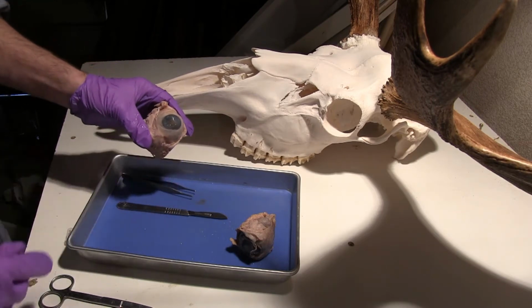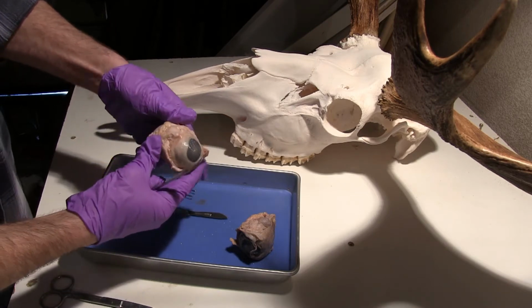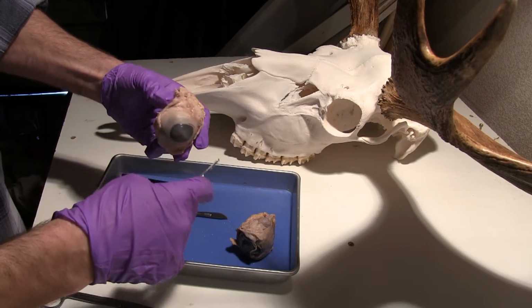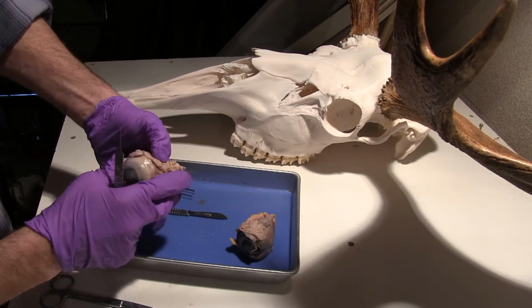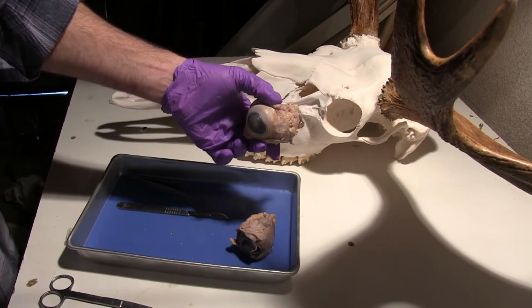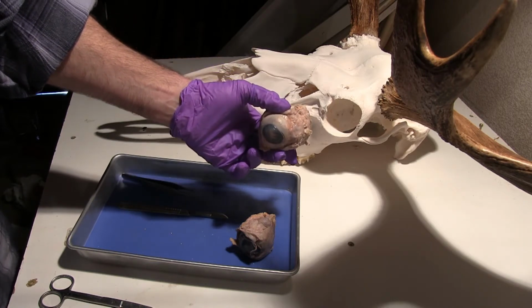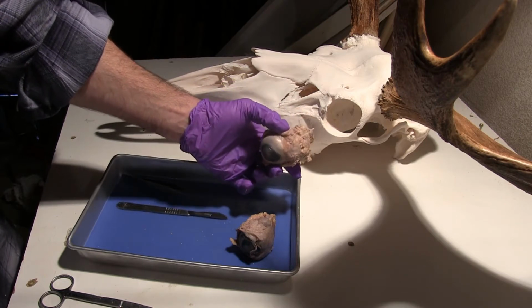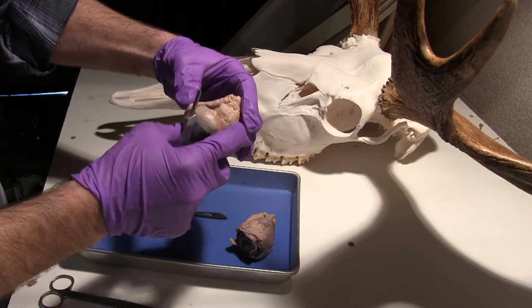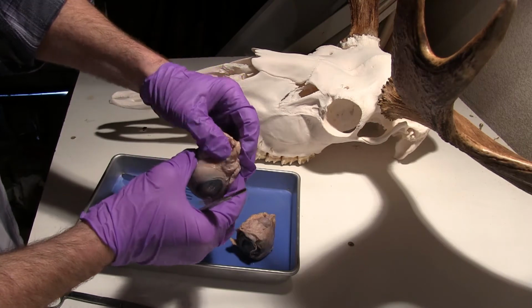So what I'm going to do is start by pointing out some of the structures that we can see on the outside here. So we see a lot of adipose tissue. And this adipose tissue is to basically create a cushion in a socket, and that socket there is actually a moose. It's not a cow, but you can see of similar size animals as far as the head and everything. This eye is probably of similar size for the moose, so you need this big fat pad to protect around the eye. As we know, it moves throughout our lifetime and we want it to be protected, so that fat pad is there for that reason.